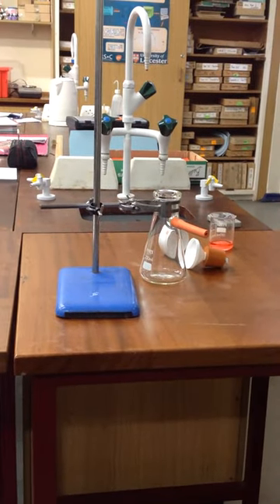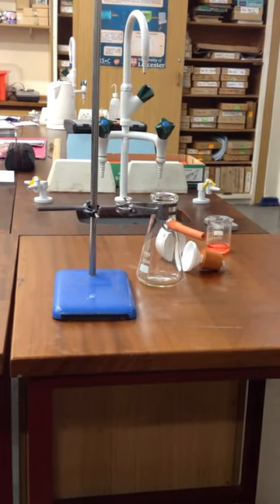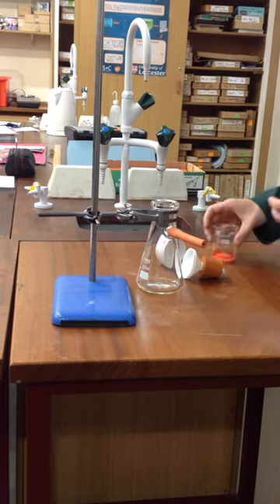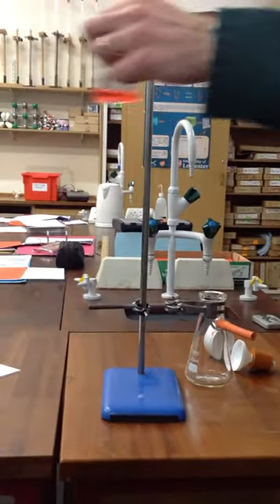What I'd like to demonstrate to you here is the idea of what we call filtration under reduced pressure. So you've got your solid, imagine that's your reaction mixture.